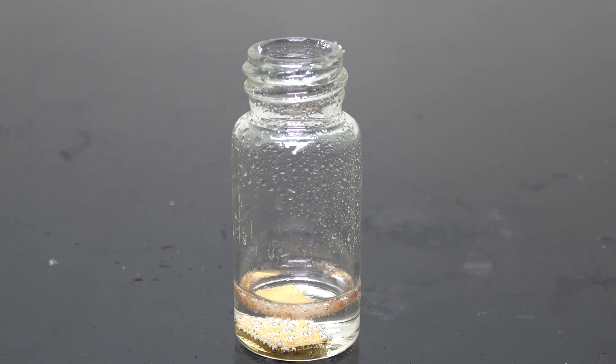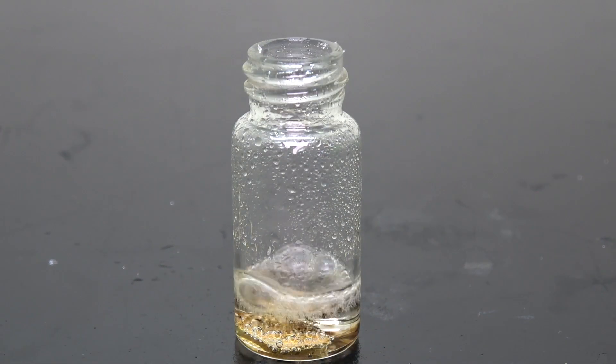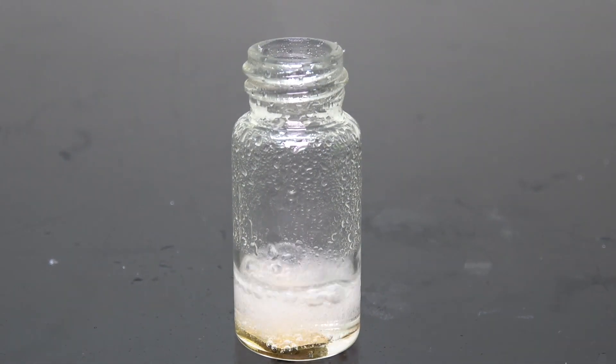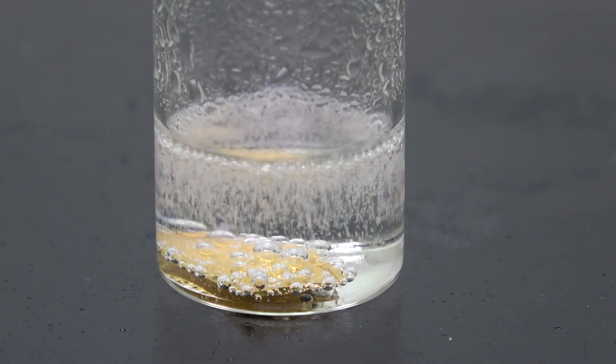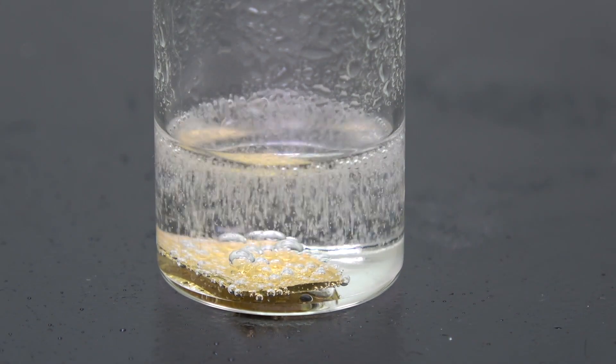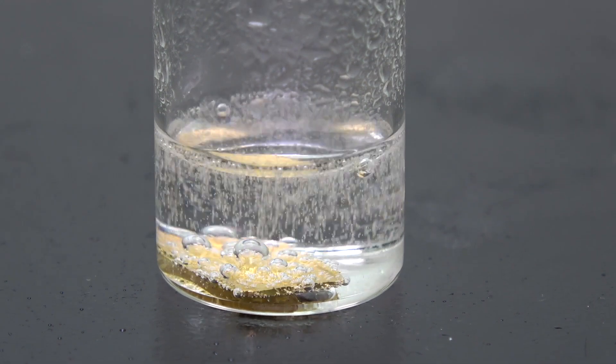How about some table sugar? Wow, the sugar was carbonized the moment it touched and soon disintegrated into gas as if it never existed. Okay, let me zoom in a little, see how the gold is holding up. Well, there are bubbles forming around the gold.